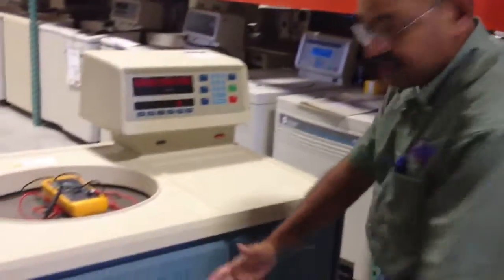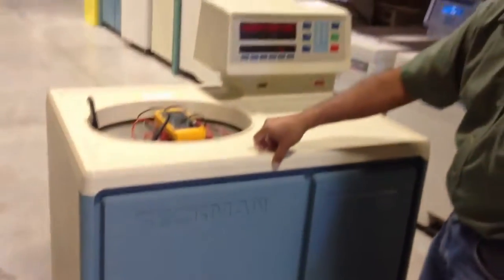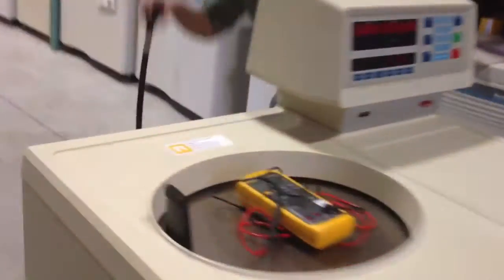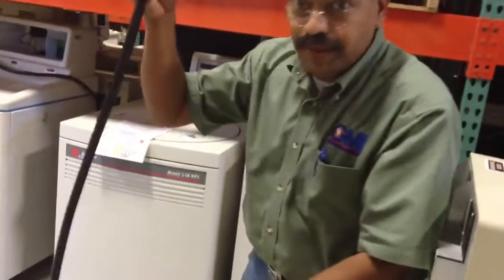I am going to quickly explain how to take the front panel off and take this cover off. First, make sure that your cable is unplugged — it's not plugged in, it should be out.